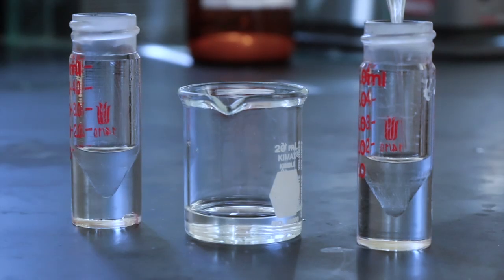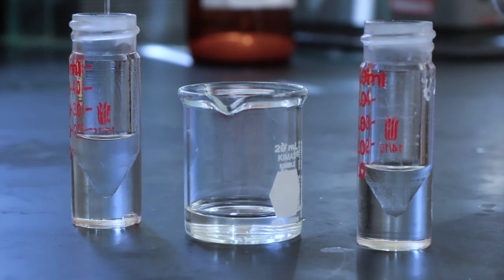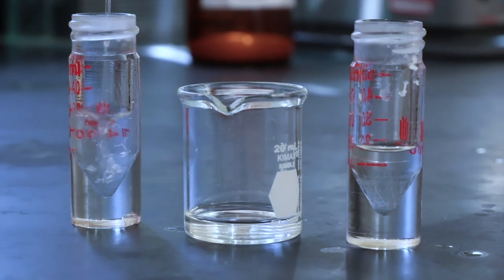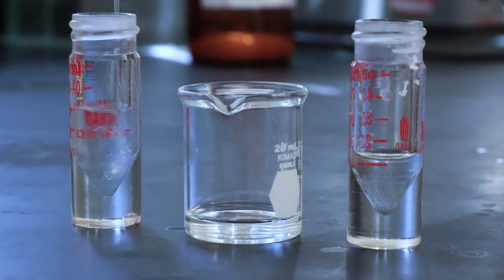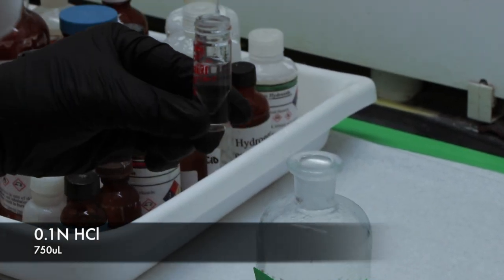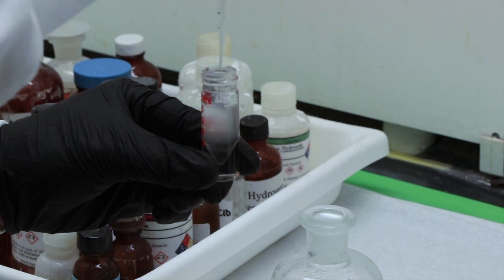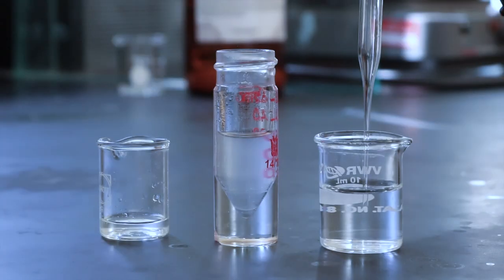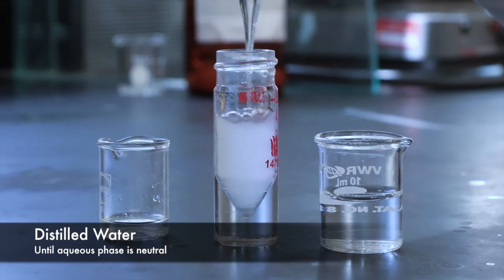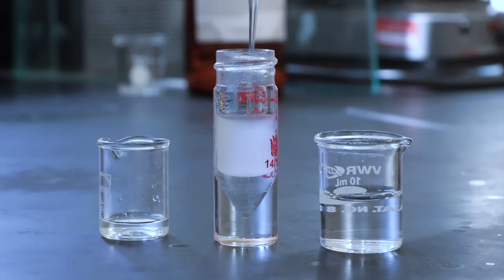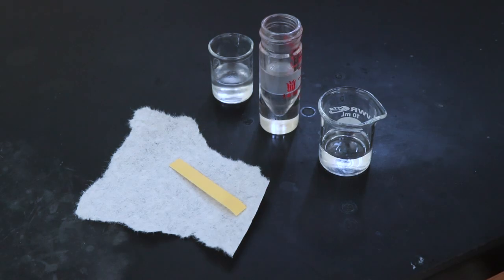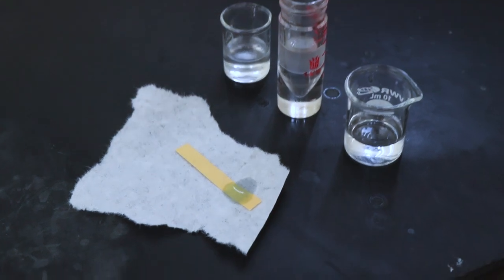It was really difficult to see the separation of the two layers so it's very possible I got some water in there but that's what drying with sodium sulfate is for right? This time I added some distilled water so we could see the layers a little bit better. I'll rinse the combined ether extracts with some HCl to remove any base that might have gotten moved over along with the organic phase. I'll go ahead and remove that aqueous acid layer and then do multiple washes with some distilled water until the remaining aqueous layer after those washes is neutral to a pH strip. This means that all of the acid has been removed and the aqueous layer is no longer acidic. We're looking for a yellowish green color so that looks great.